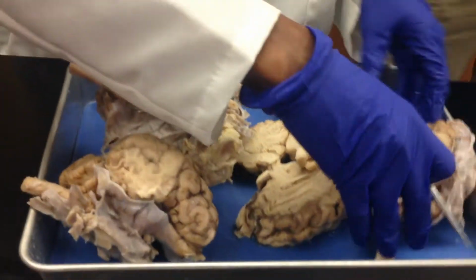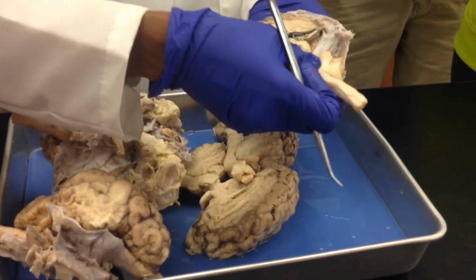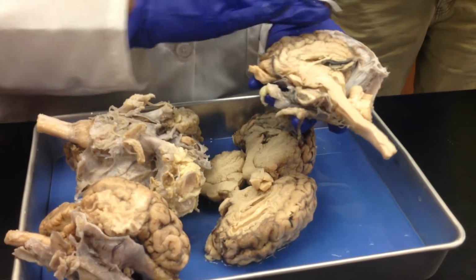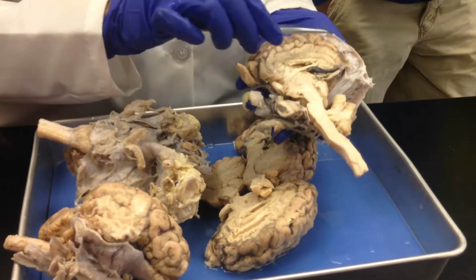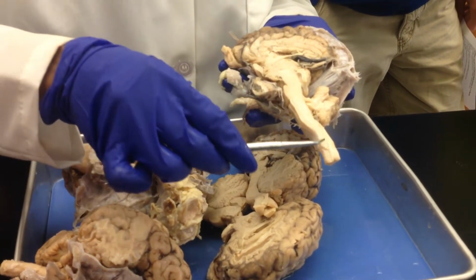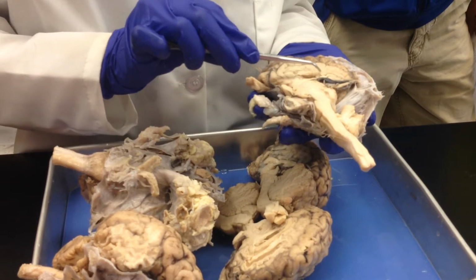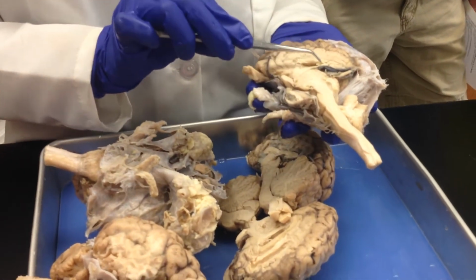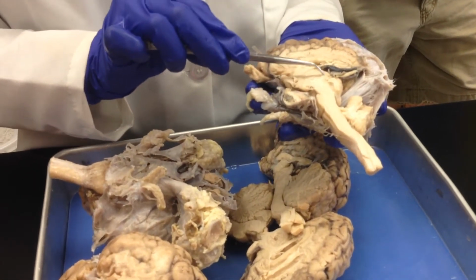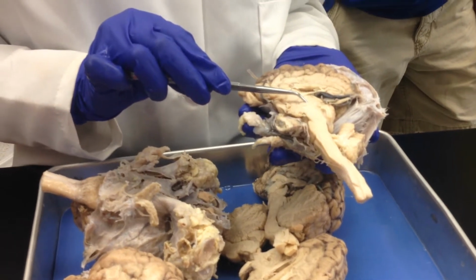Now let's look at the sagittal section of the brain. Depending on which one, it's going to look slightly different. Okay. Now when you look at the sagittal section of the brain, once again these are your cerebral lobes. This region is your diencephalon, pons, medulla oblongata. Okay. Now in here, this structure is your corpus callosum. That is your fornix. There's the thalamus, and the center of it is the intermediate mass of the thalamus.